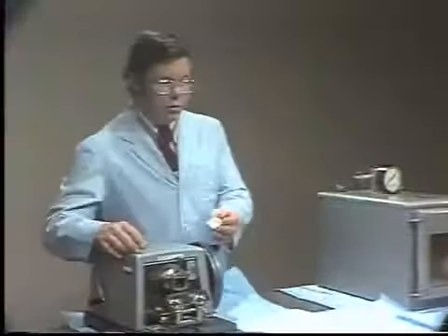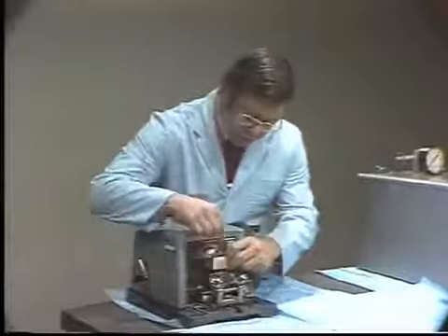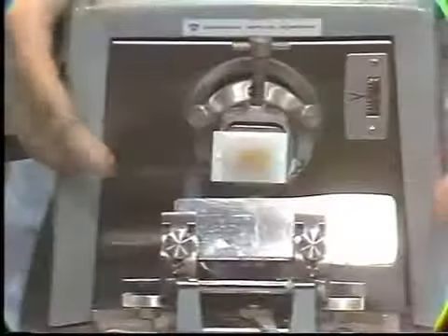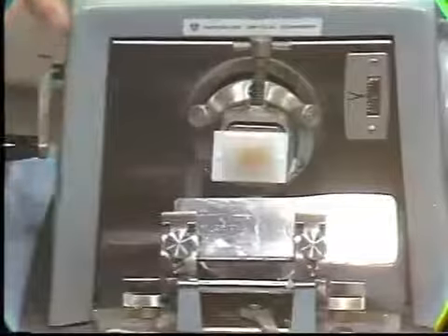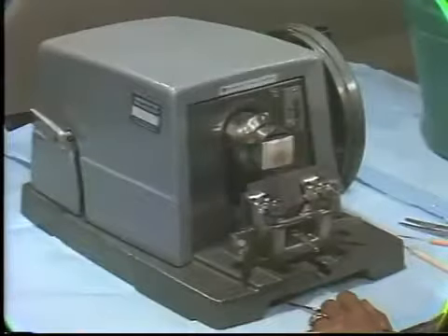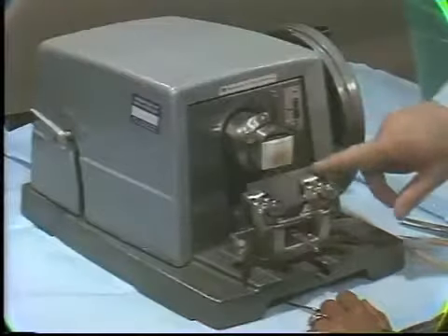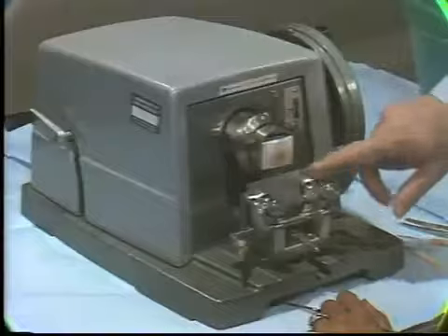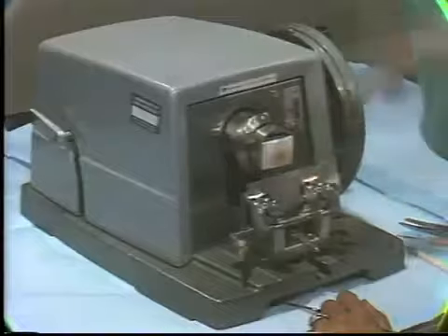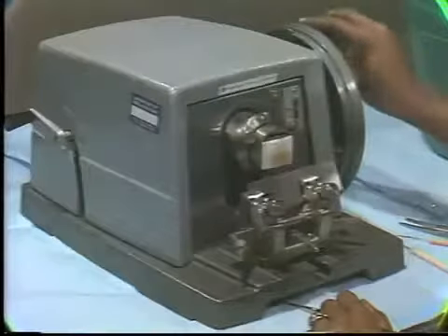Here we have a microtome, and I'm going to place this block in the microtome so that we can thin section it. The next step now will be the sectioning of this paraffin block. This rotary microtome is set up so that the tissue will pass by the very sharp microtome blade. This is the blade down here, and the tissue will pass through that. Now we'll show you how that looks in preparing these thin paraffin sections.